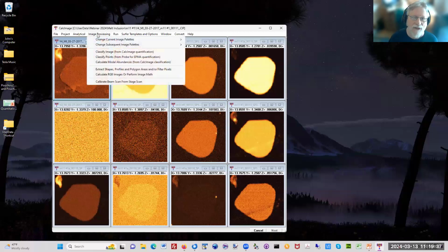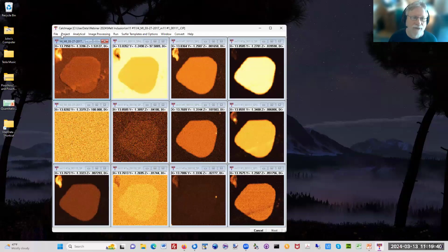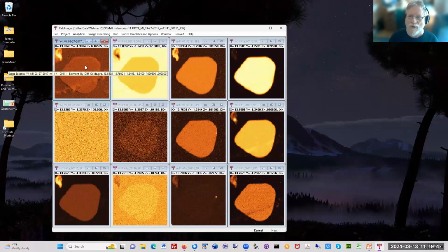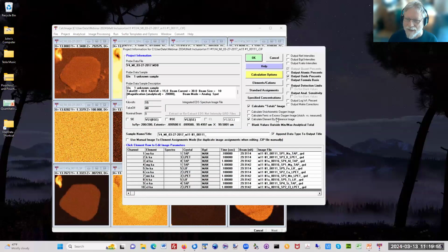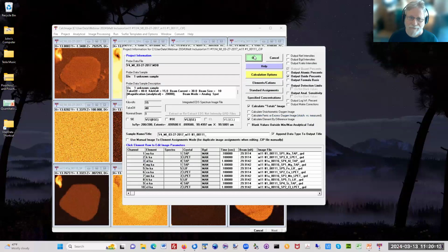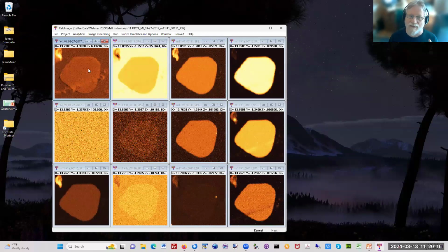I could show that. I'm going to use a different project for this. But here's the cool thing. If you don't include the element by difference here, so I've checked here, calculate element by difference image. If I don't calculate element by difference image, but I do include water as an element in the correction, which I have because you can see it's right here, element by difference is right here, hydrogen. And since I'm calculating as stoichiometric oxygen, it's water, then it will calculate the matrix effect of the water, but not calculate a total of 100%. So you'll actually get a real total, and you will have the water by difference accounted for. So that's pretty cool.